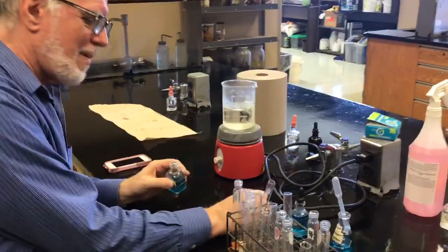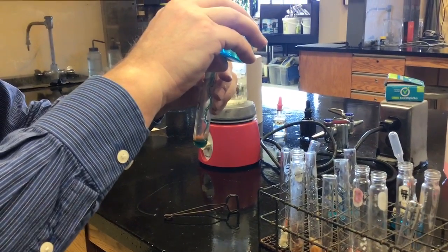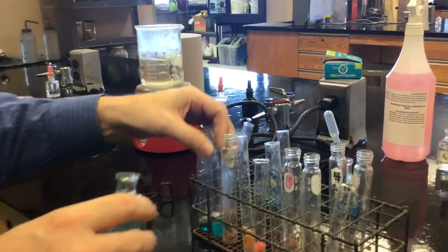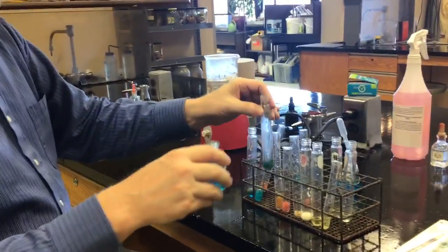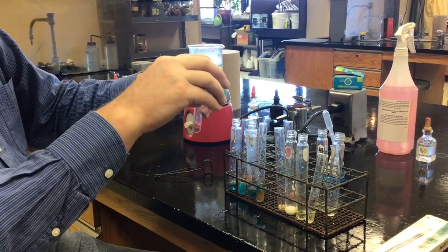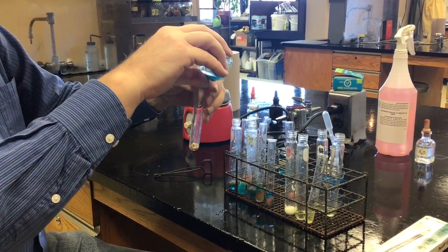Like we did before, I've got a whole bunch of ground stuff in the test tubes. I'm just going to pour Benedict's over it. It will not change on contact, so I don't have to worry about that. But I need it to start blue, so if it changes color I'll know it changed. Benedict's is the one we're going to have to run a color control on — I'll show you that when I'm done pouring.